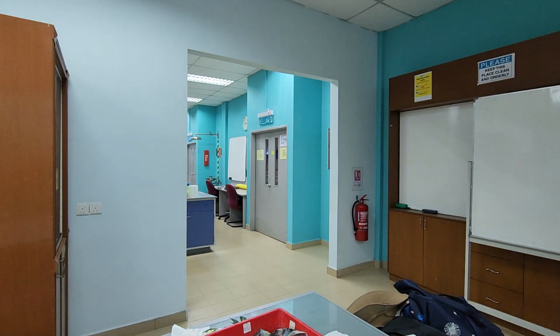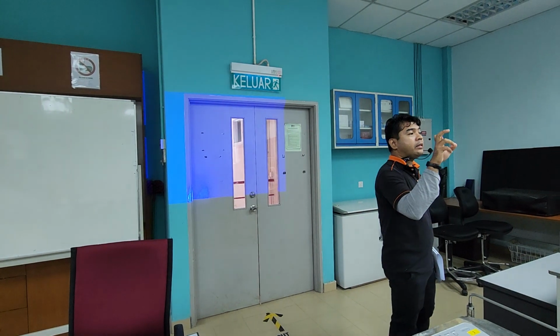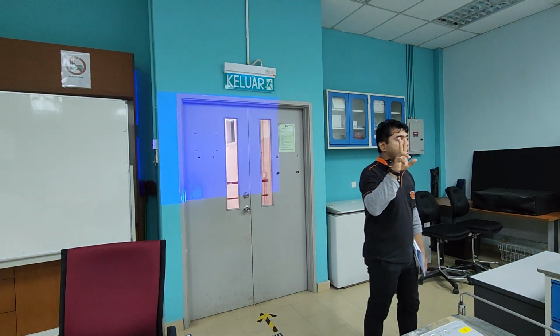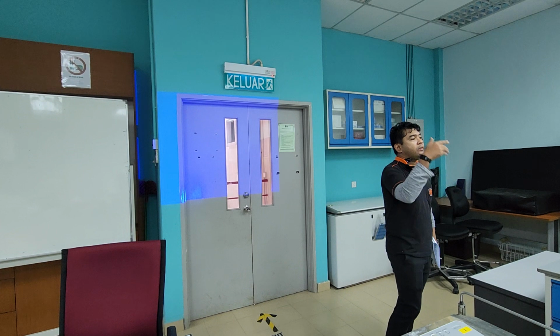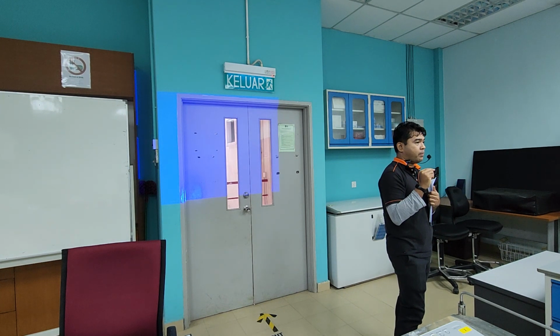So today we're going to be doing two activities. The first one is the leaf area determination, which you are going to be utilizing two methods. The first one using the leaf area meter, which you have dealt before a few weeks back. And the second one is using the graph paper. That's why you are provided with graph paper.